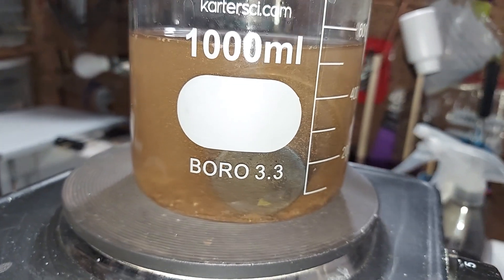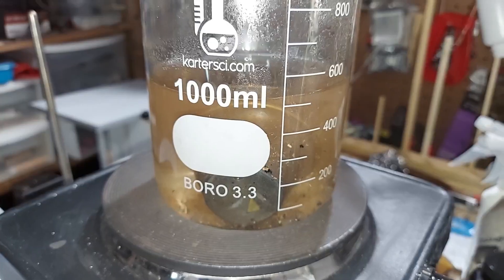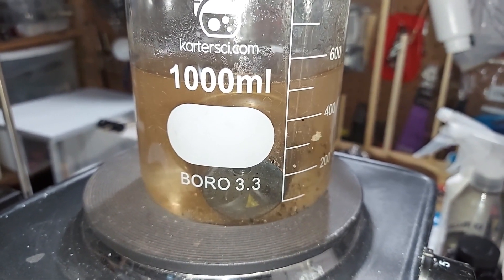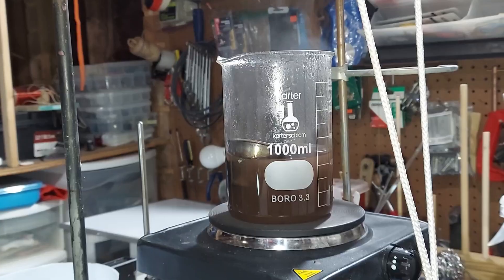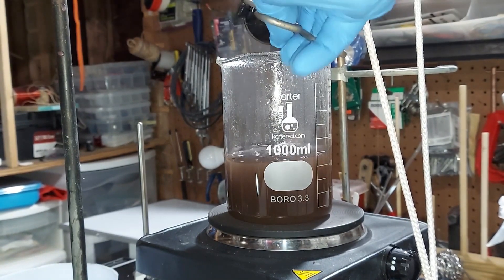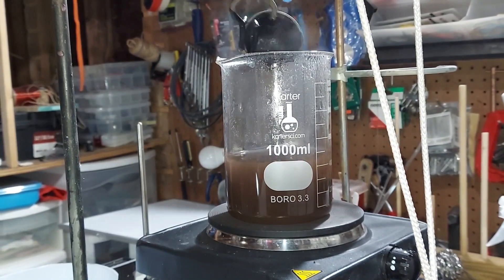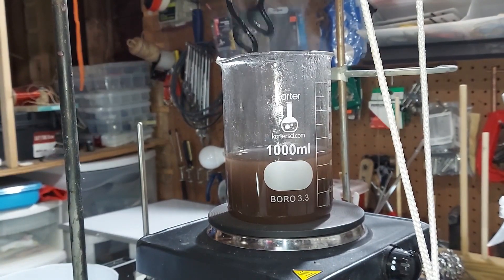I'm going to boil this water until that stuff's all dissolved. As this heats up and starts to dissolve what's in those cups, it really looks like muddy water, but after filtering things will be different. It's at a good boil right now. Normally I leave this around 10 to 15 minutes at least for it all to dissolve. It's actually been about 20 minutes now, so I'm going to take these out. I'm sure whatever is useful has been dissolved.